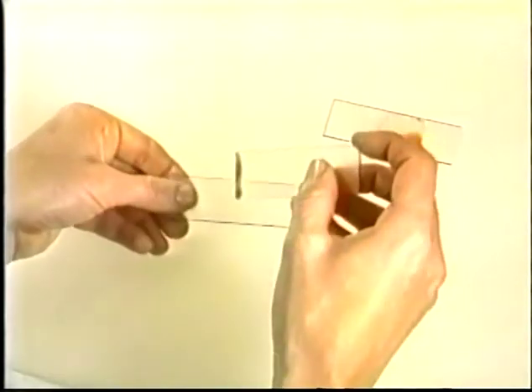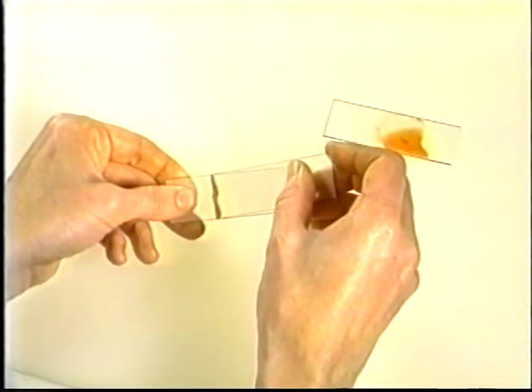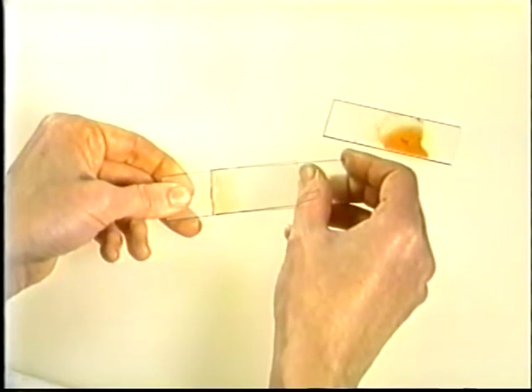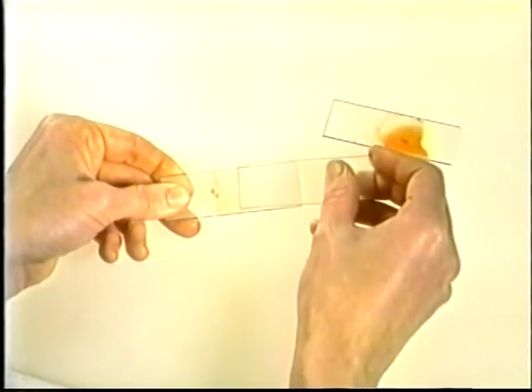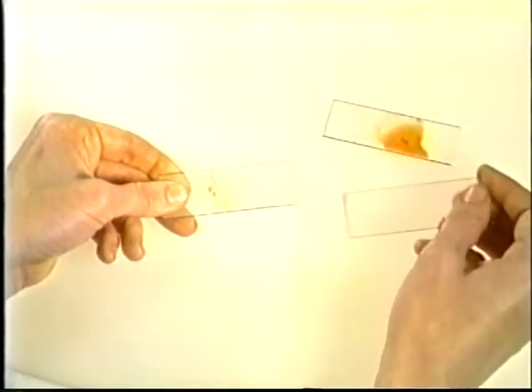Replace the bottom slide with a clean one and smear the harvest by putting the slides together at an angle like this. Rotate the top slide until it rests flat on the bottom slide, and then smear, taking care to keep the slides parallel to avoid scraping the harvested cells.